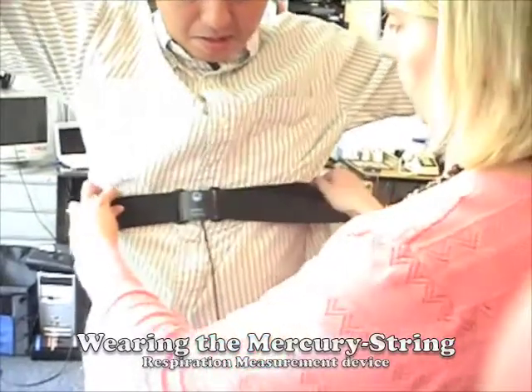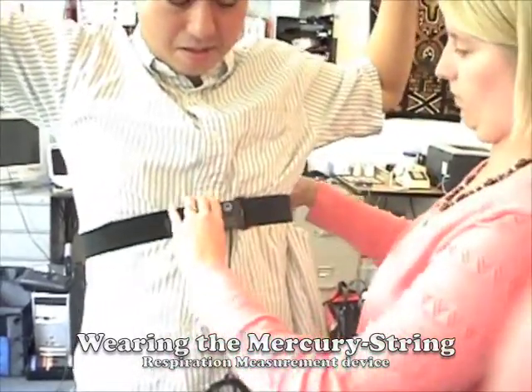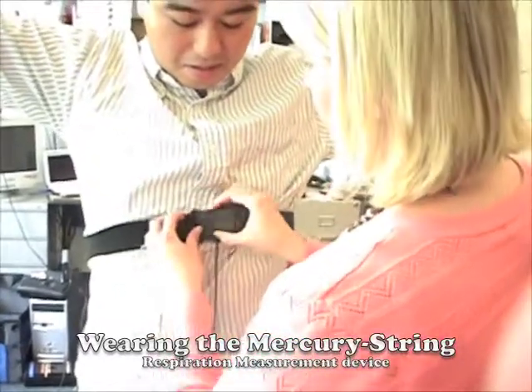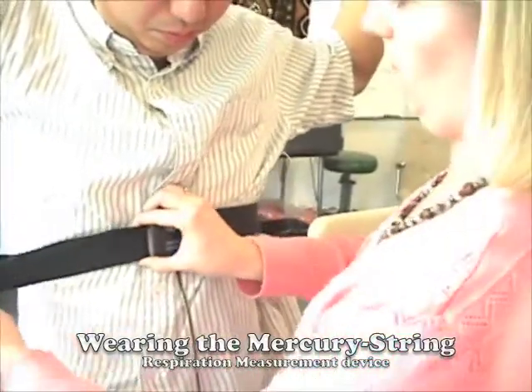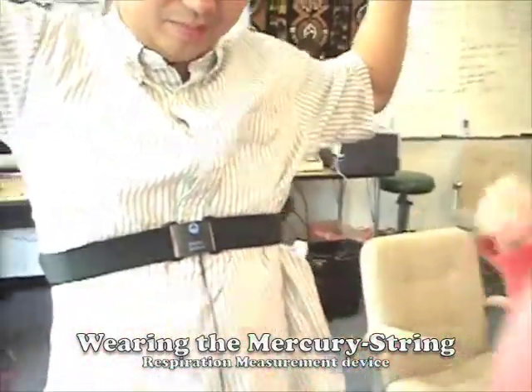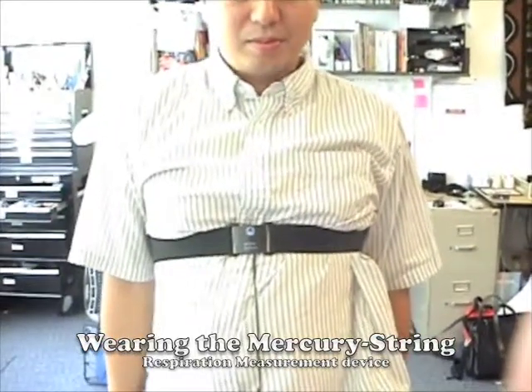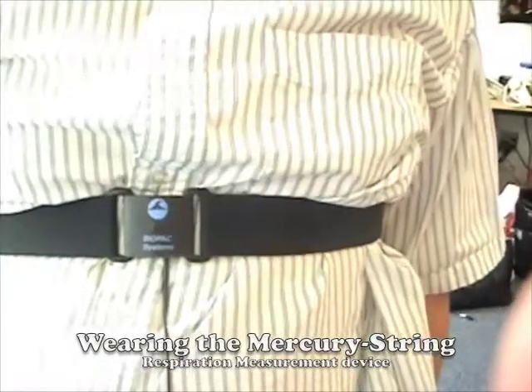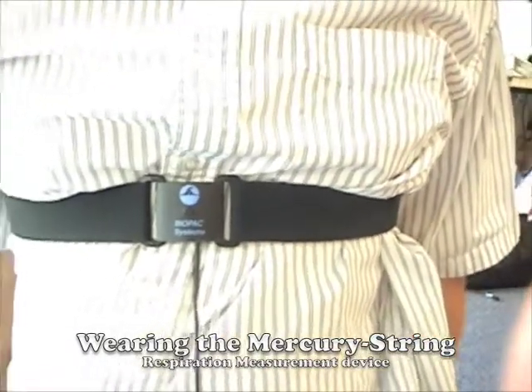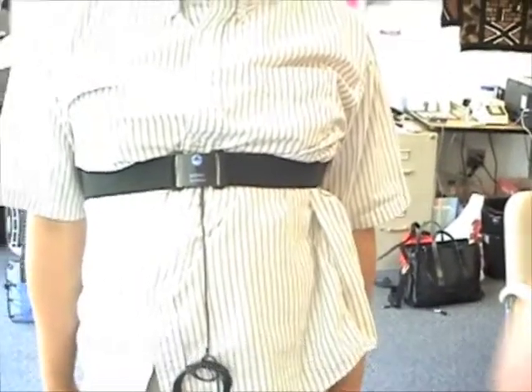So you want this to be squared up on their chest. Make sure that it's kind of tight, but not too tight. And then as they breathe, we can tell when they're taking a deep breath, and as you can see, this part's moving in and out as he breathes. And that's how that works.